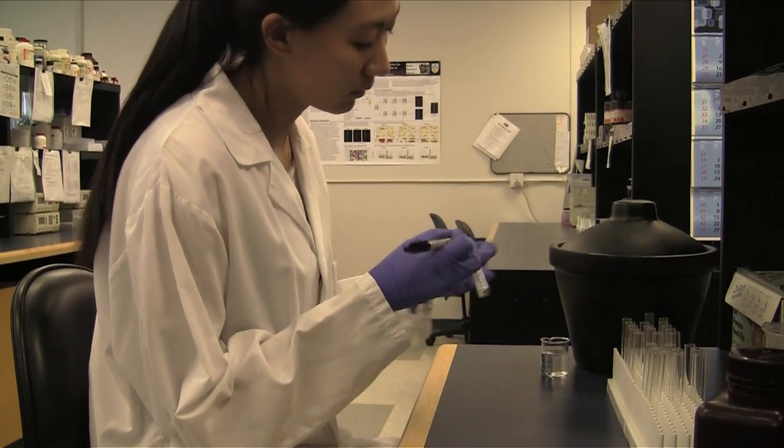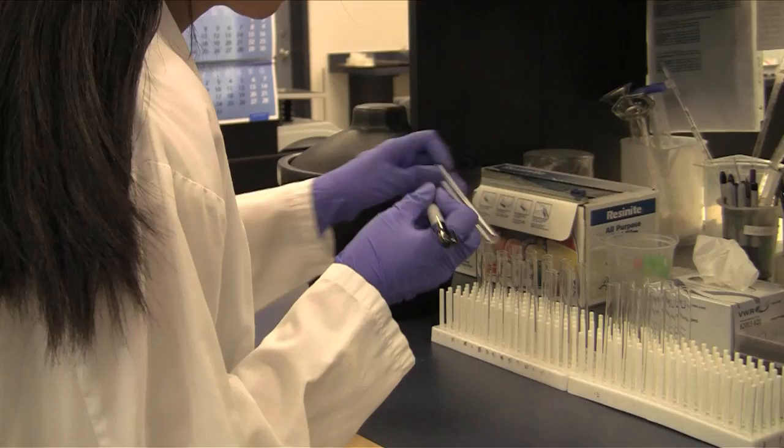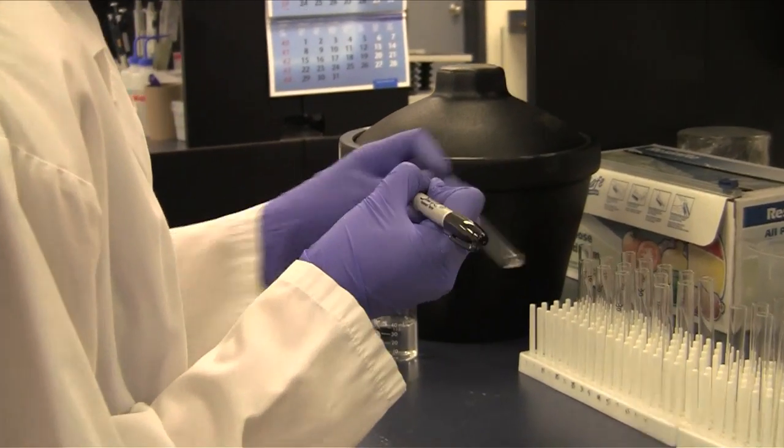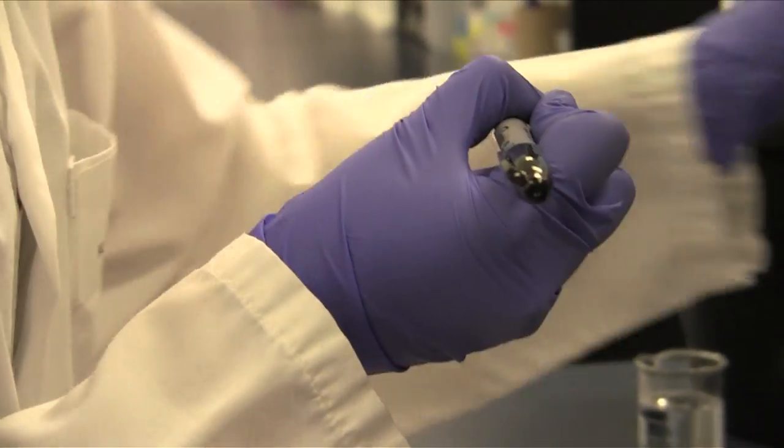Set up and label glass tubes for measuring protein levels in the protein standard and in your test samples. We use bovine serum albumin or BSA as the protein standard.